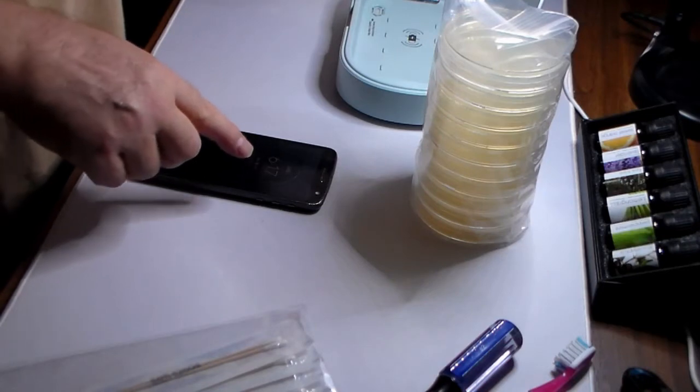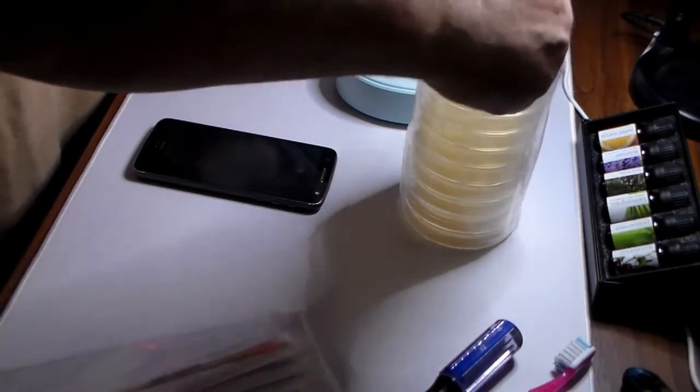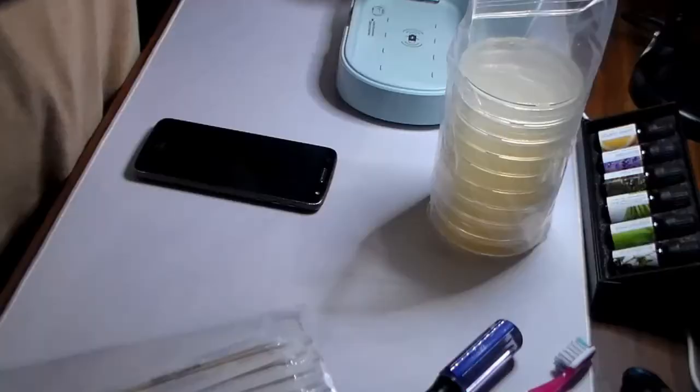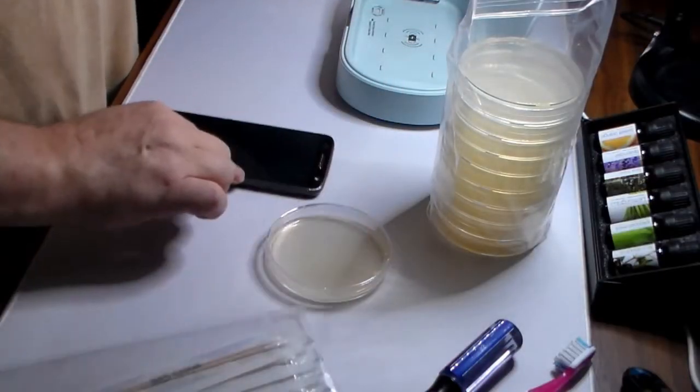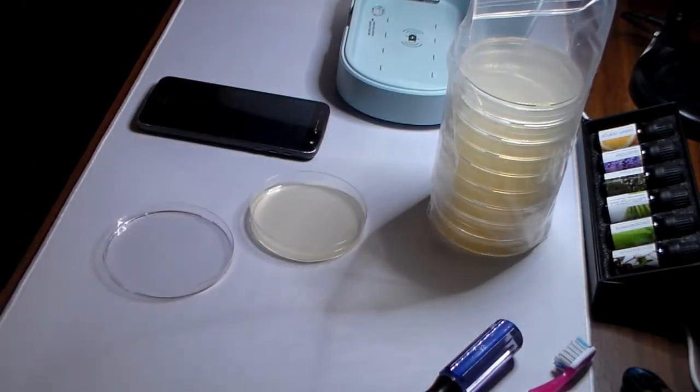Okay, so we're going to take the phone. We're going to swab the phone. We're going to put the phone in the agar. Not the phone. We're going to swab the bacteria on the agar. We're going to seal the petri dish. We're going to label it. We're going to place it in the Ratchet incubator. I have been able to calibrate the incubator. Now also we know that we need to place it upside down when we place the agar. Alright, the agar is now exposed to the air.